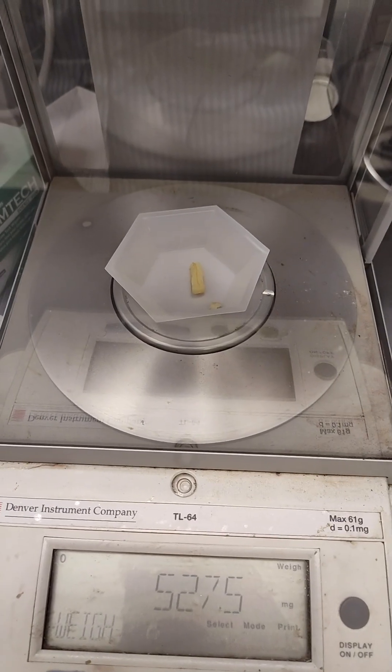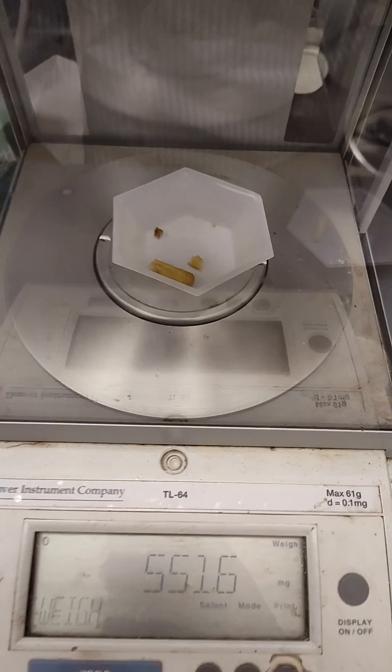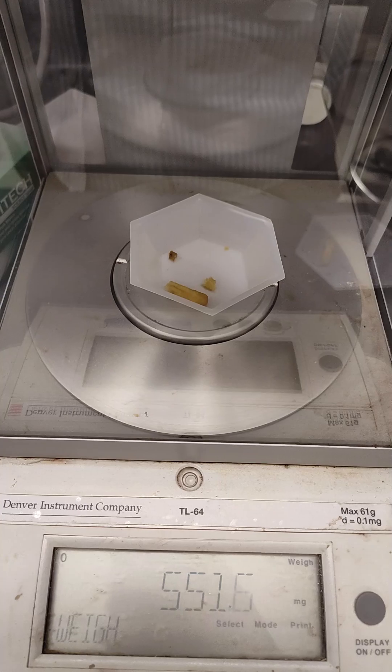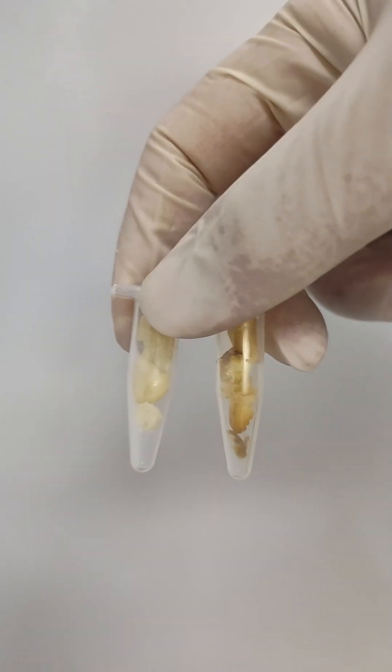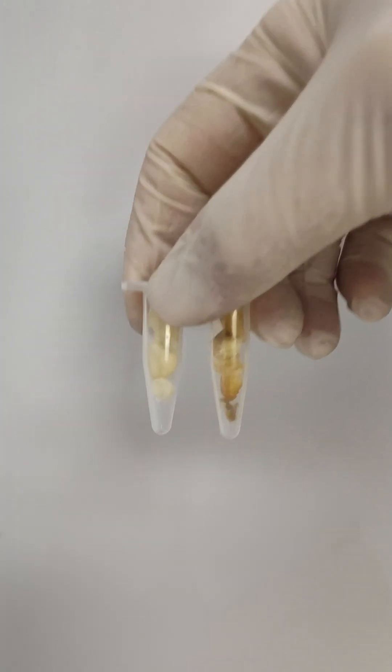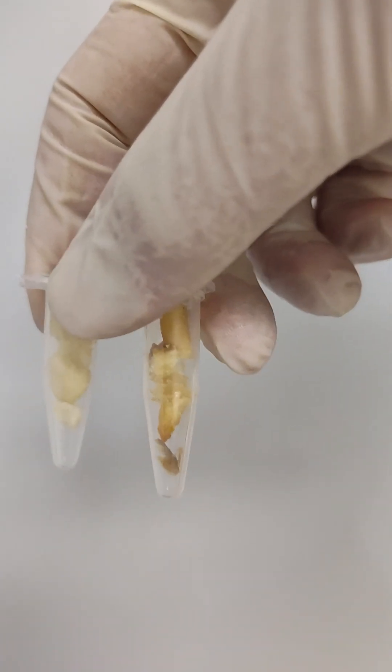Alright that's about 500 milligrams of the McDonald's french fry. And the same thing for the Wendy's. So we're doing a kind of control this time. Pretty normalized. Just one fry each though. Alright we got them both in the tube. It is so obvious which one's McDonald's on the left and then you got the Wendy's on the right. Same amount of mass.